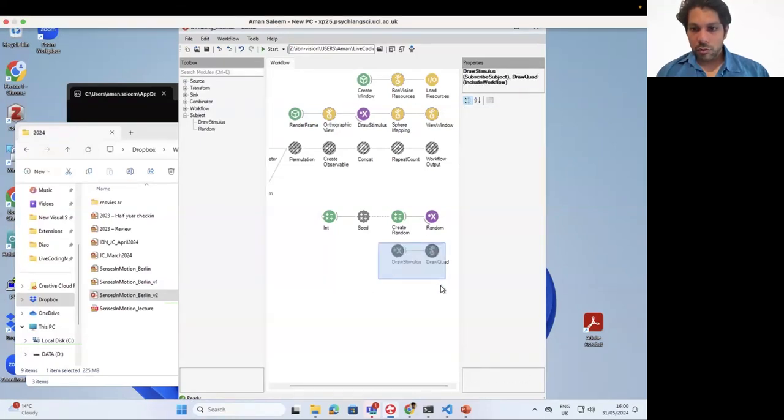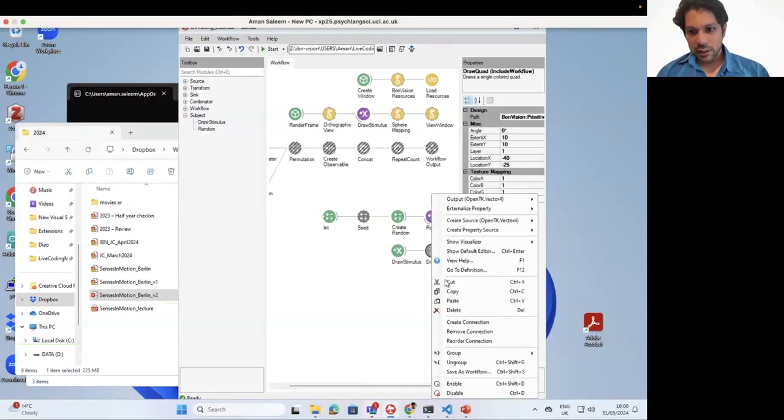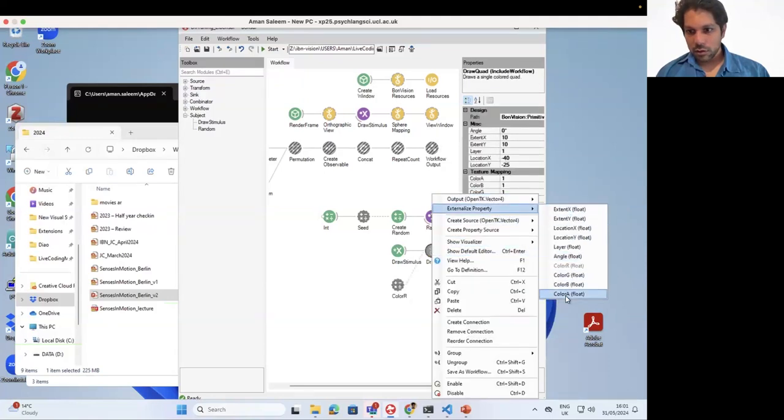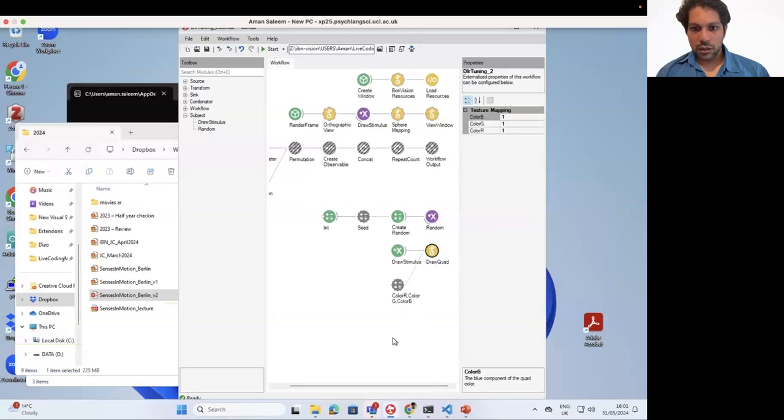I'm going to make this a group. So let me first externalize some properties, because we just want to convert. The zoom window comes in the way, so I just want to get the colors out: R, G, and B. And I'm going to create a float, maybe a subject. I'm going to call this quad state.